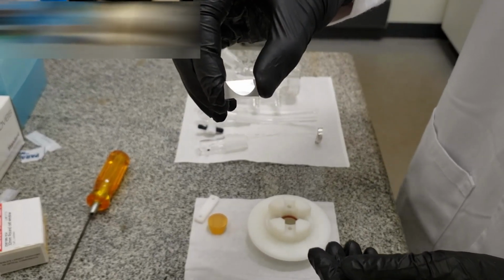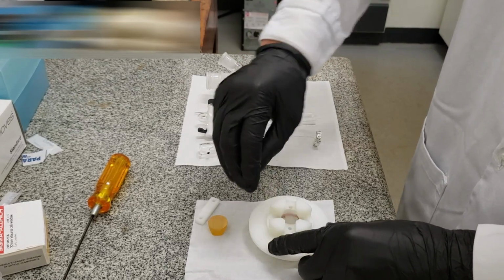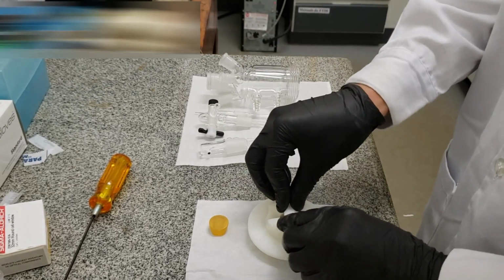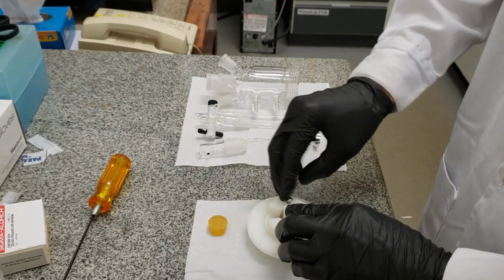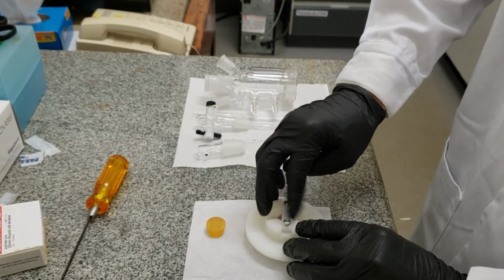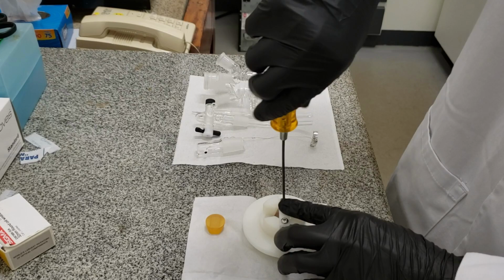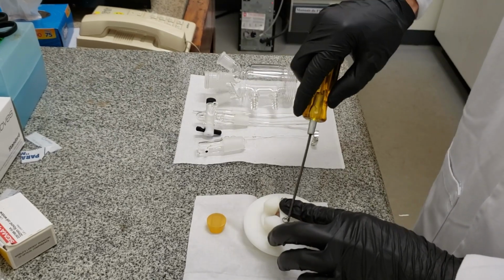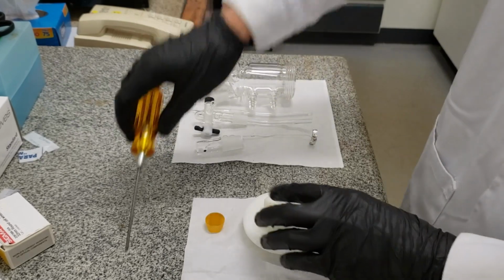The calcium fluoride prism is the most used for conventional reflectance experiments. You can use, for example, the zinc selenide prism and deposit onto it a thin layer of gold and perform an experiment in the ATR-FTIR mode. ATR stands for Attenuated Total Reflectance. You can do SEIRAS, and there are many options that I will not discuss here.